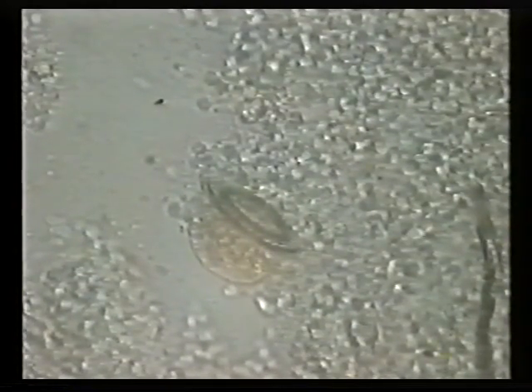They are able to move freely across the fish's body surfaces, attaching and detaching at will. They have a direct life cycle which can occur entirely on the host. The damaged area quickly attracts many thousand bacteria organisms, which are the parasite's intended prey. They can endure a wide range of temperatures and can be a very persistent parasite to totally eradicate.